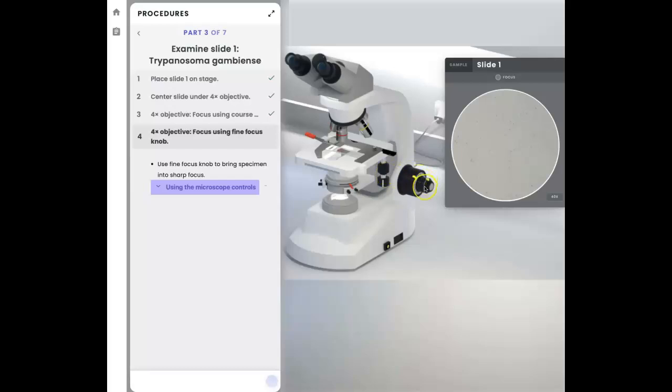So using the fine focusing knob, let me see if I can demonstrate how that focus check mark shows up. So here we go. I'm going to click on that, slowly move it in one direction or the other. See it disappearing right there. So that tells me that I'm going in the wrong direction. So I'm going to start heading back in the opposite direction, which in this case is actually counterclockwise as far as I can tell. Now I'm beginning to see the image show up. So I'm watching also, in addition to the image, that little word focus to see if I see a check mark. So here we go.